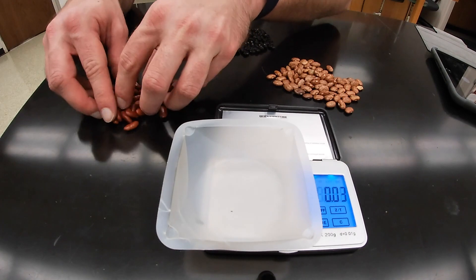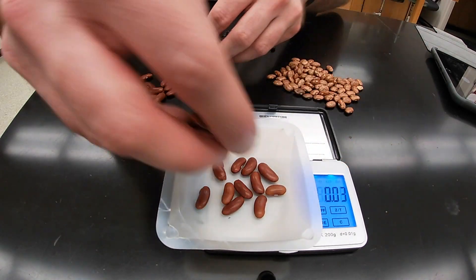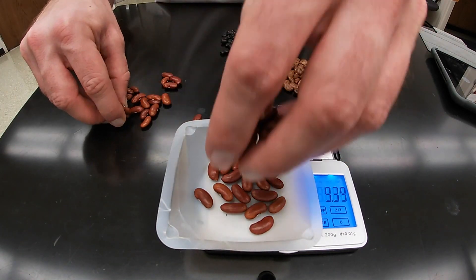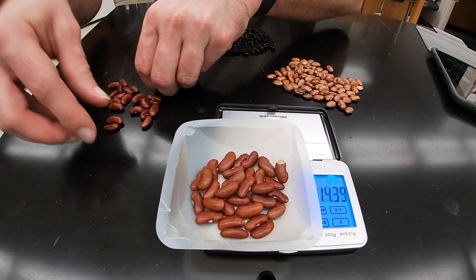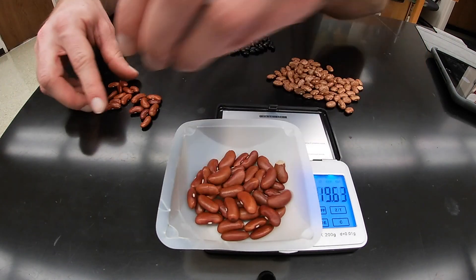Now I'm going to add all of my red beans to the weighing boat. Since I tared the weighing boat, I'm just taking the mass of the red beans.